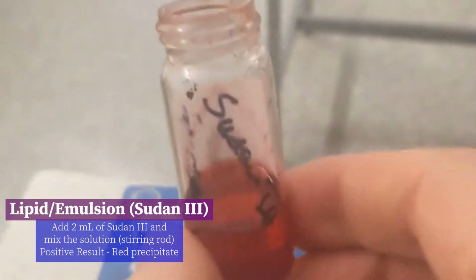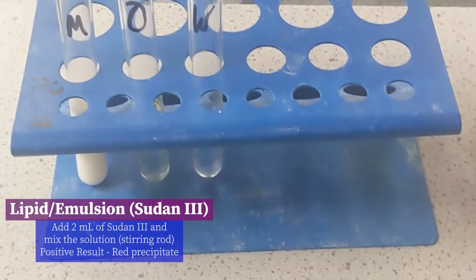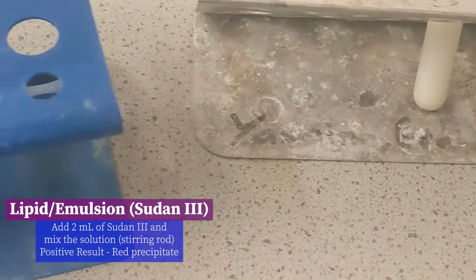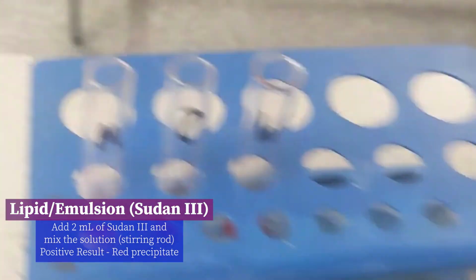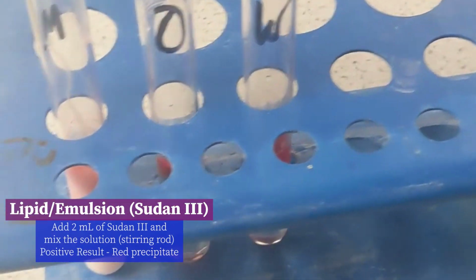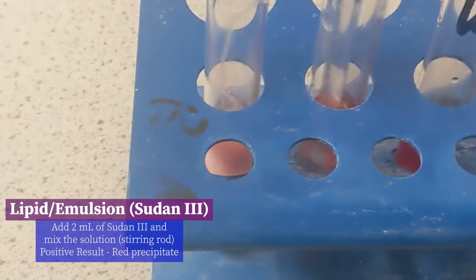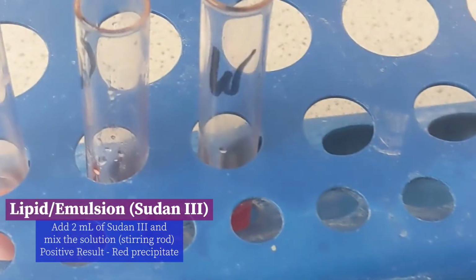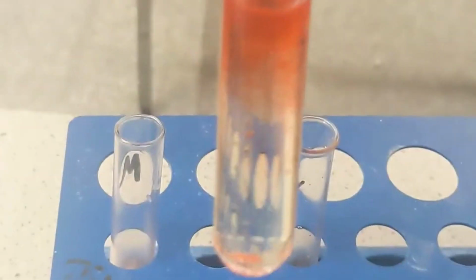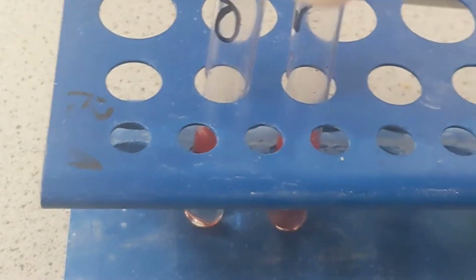With Sudan III, it's a red solution. I go through all the same steps, nothing different. The only difference is now for a positive result, I'm looking for this red mixture, cloudy bit up here at the top. There we go. That's the precipitate I'm looking for if it's a positive result with Sudan III.